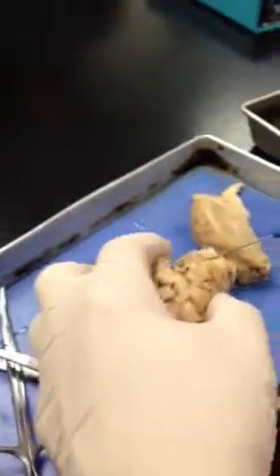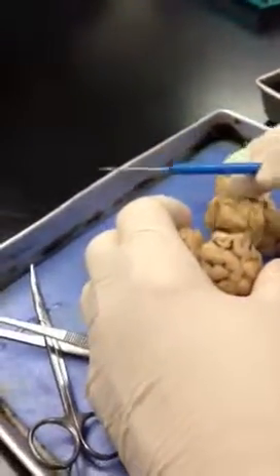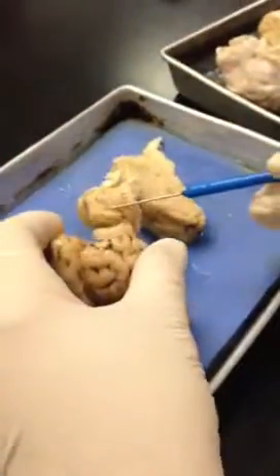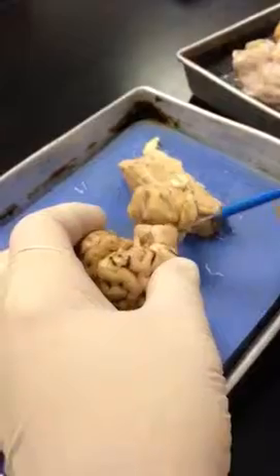And maybe... Oh, you can see it here. Oh, here we go. You can see it here pretty well. For those of you who are filming, I'm trying to get my finger out of the way.